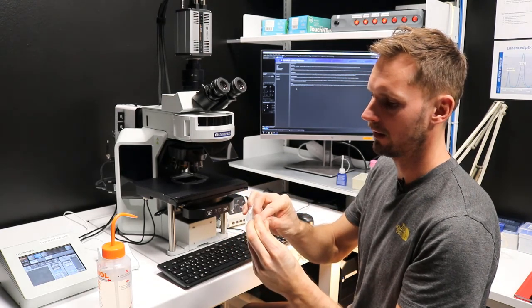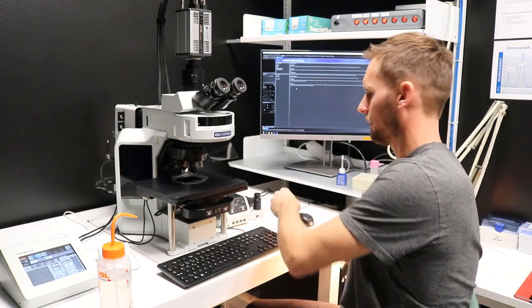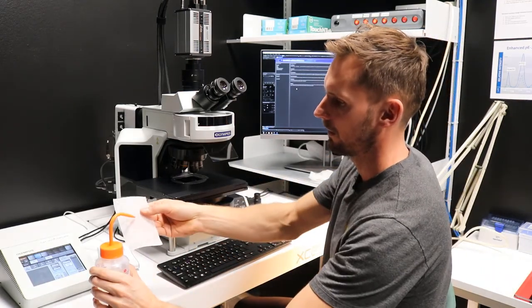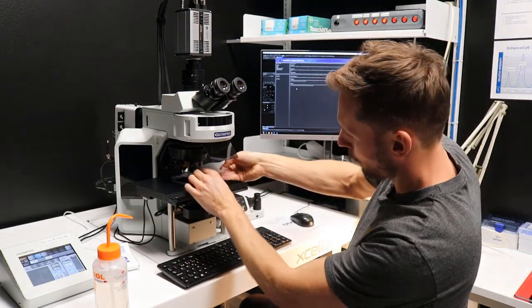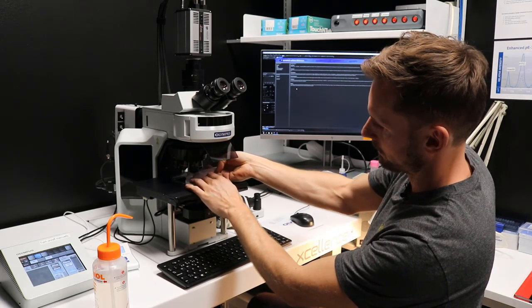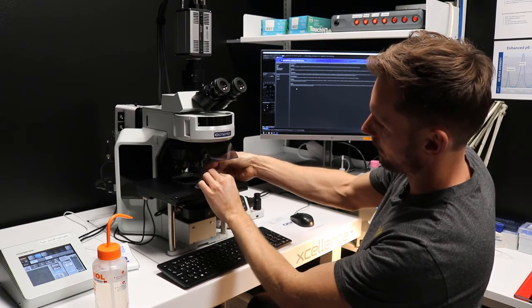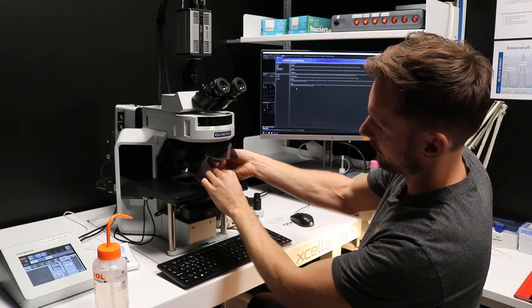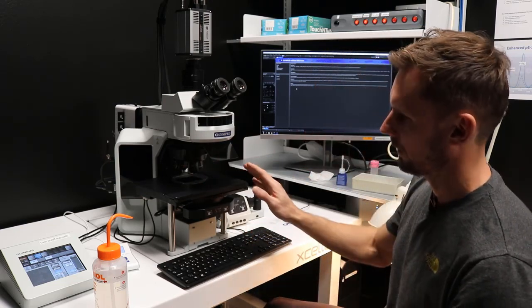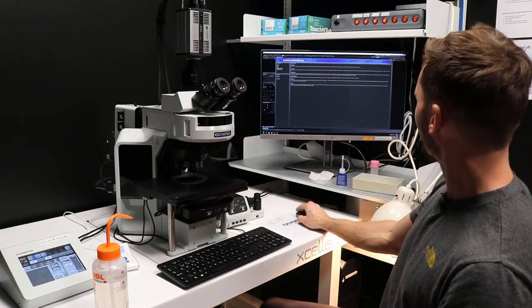In this case it's sealed, so it's not important for me. And you take a new piece of paper, and then you wipe the lens with circular movements, something like this. And then wipe it with a gentle hand with a piece of the dry part. So now it's clean, and we're ready to shut down the software.